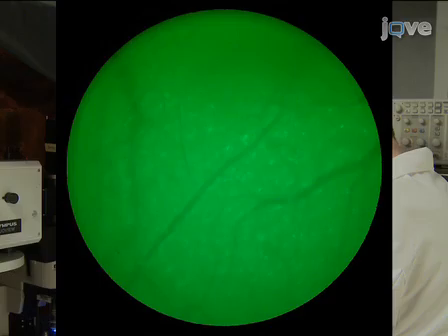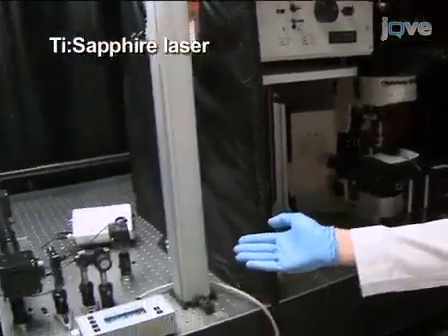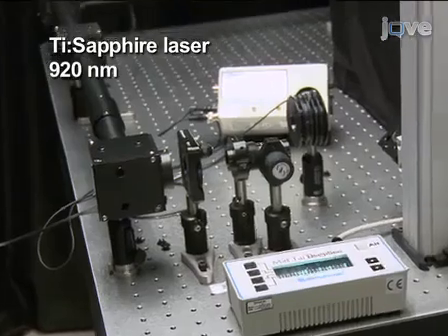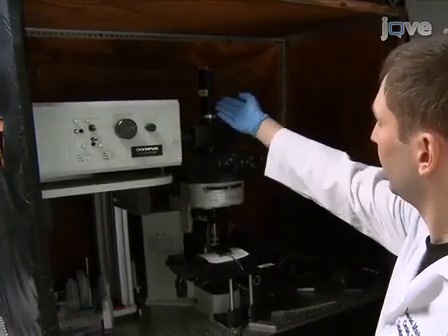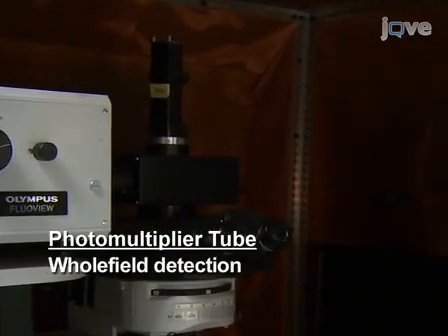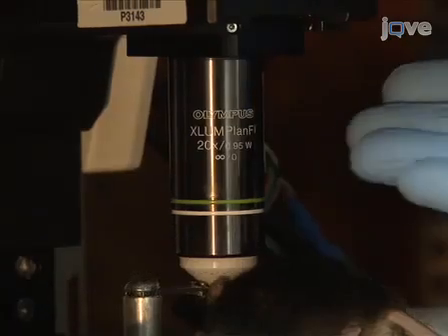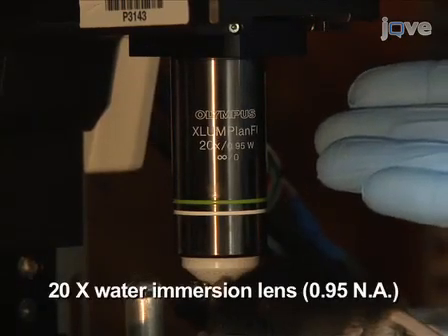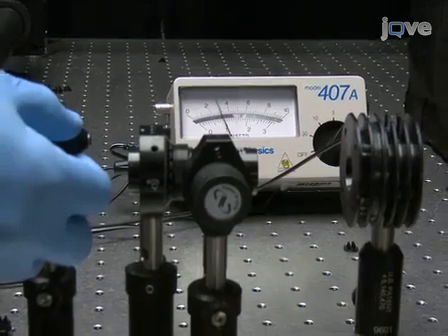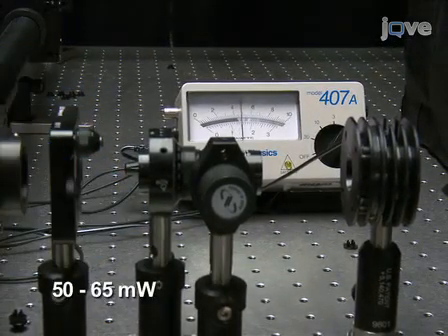For imaging shown here, a custom-made two-photon microscope with a Ti sapphire laser tuned to 920 nanometers is used. Fluorescence is detected by using a photomultiplier tube, or PMT, in whole field detection mode and a 580-180 emission filter. A 20x water immersion lens is used throughout the imaging session. Set the maximum output of the laser power at the objective between 50 and 65 milliwatts.